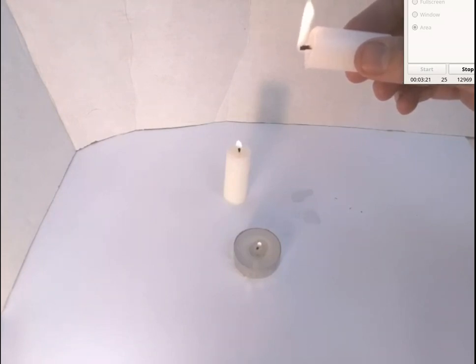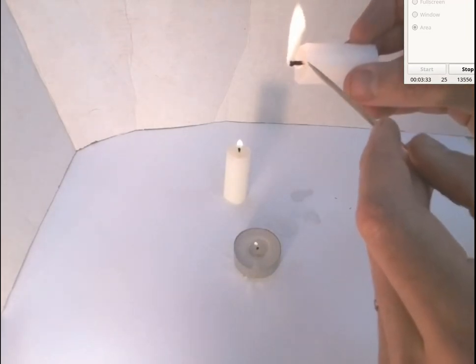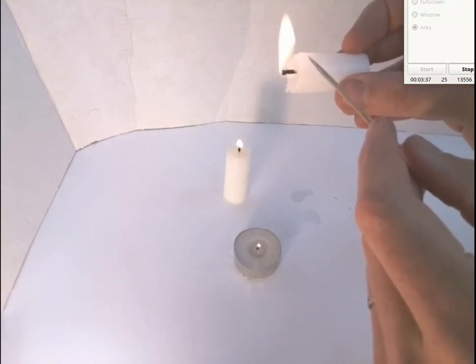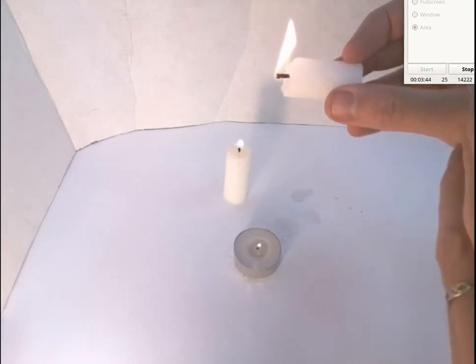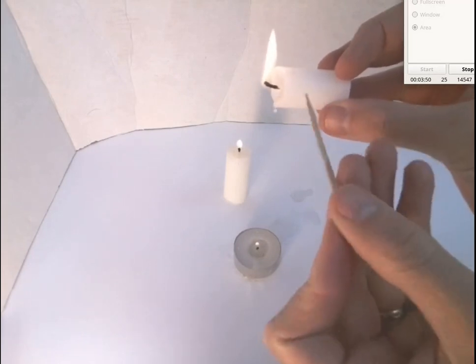Now we've got a flame where towards the base of the flame, down by the wick, the flame is in contact with the wick at one end, and at the other edge of it, it's got this kind of triangular area which is completely transparent. Now what we know is the transparent areas are areas where complete combustion is going on. There is still vaporized wax being burnt, but in that area there's plenty of oxygen and that vaporized wax is being completely burnt.